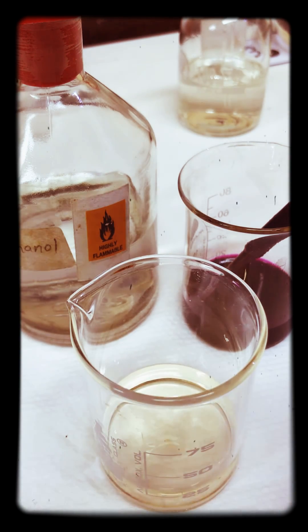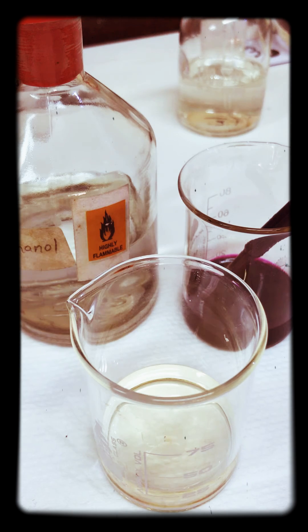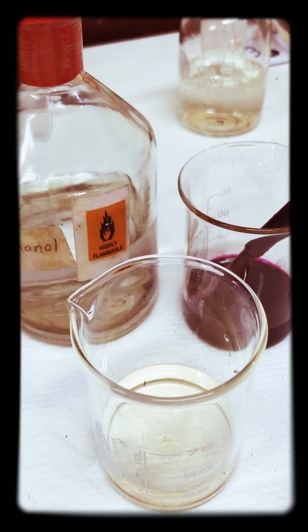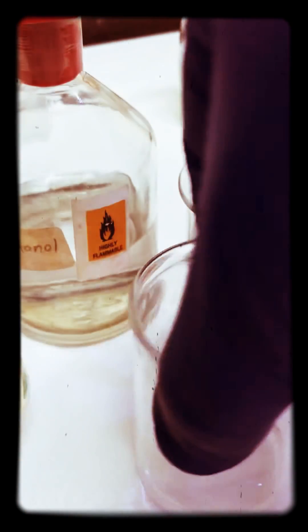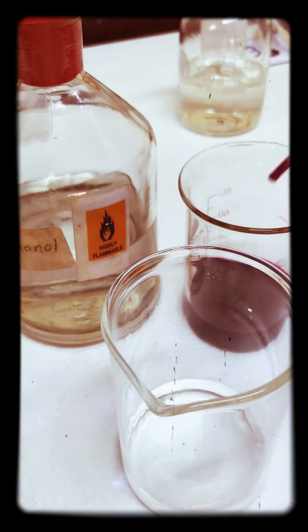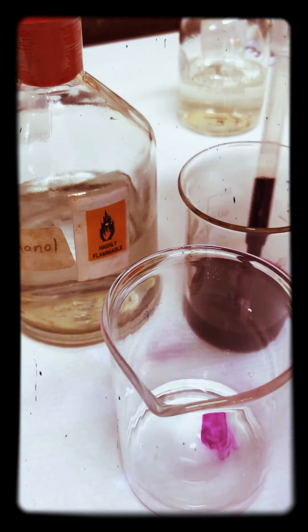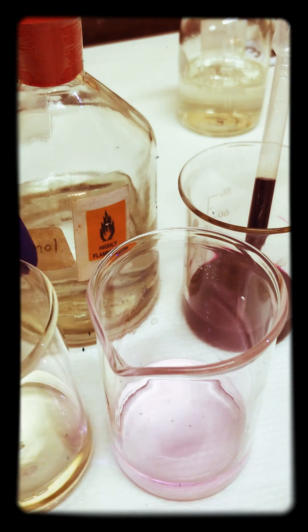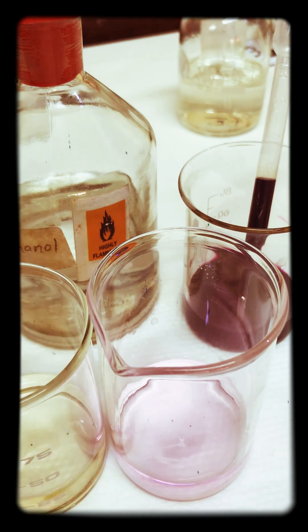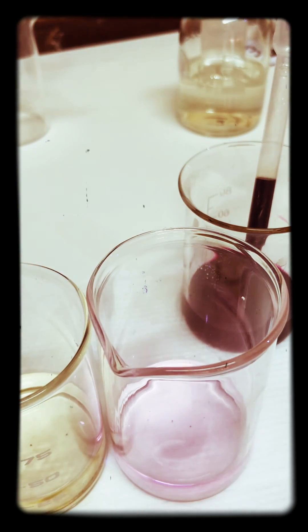Whereas if you were to add this to water — just a sample of water, here's a sample of water — we'll just find just that same one drop. We'll turn it pink. There's a clear difference. There's definitely a decolorisation that's taking place inside here.